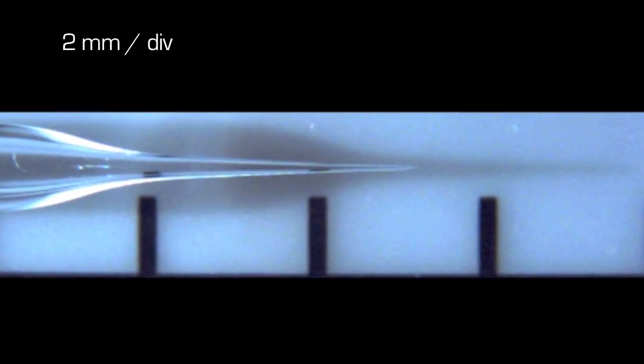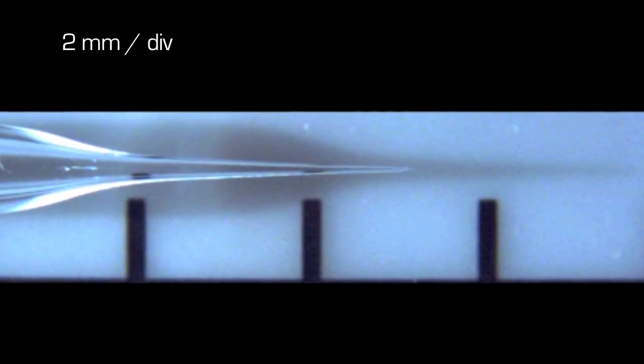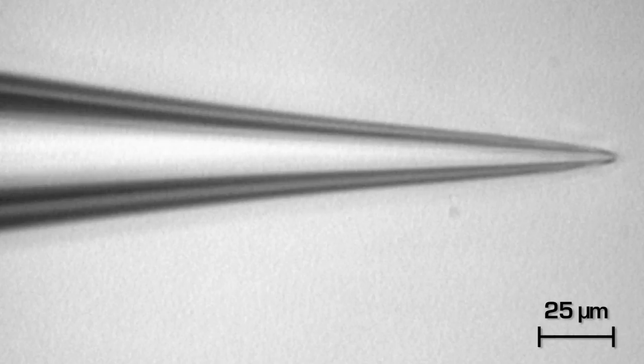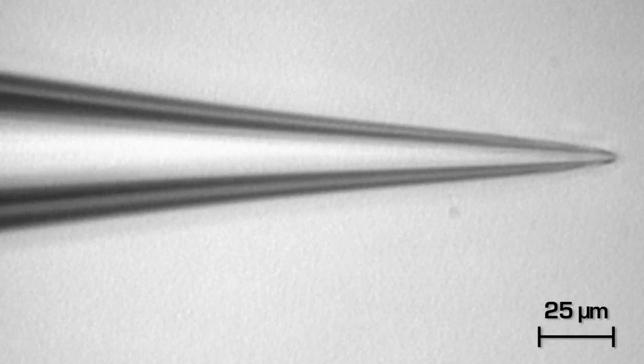The close-up shows a smooth taper with an angle of about 1.5 degrees all the way to the tip. There is only a hint of a shoulder from the second pull just above the marker in the center of the frame. At higher magnification under the microscope, the very tip of the pipette becomes visible. The diameter of the pipette opening is of the order of 1 micron.